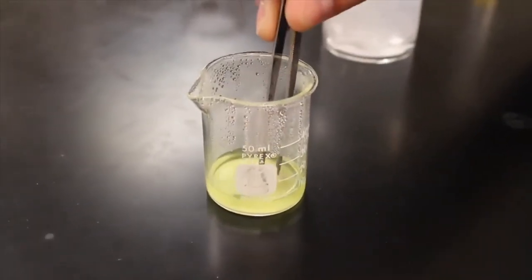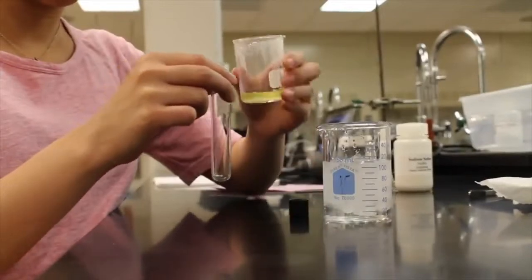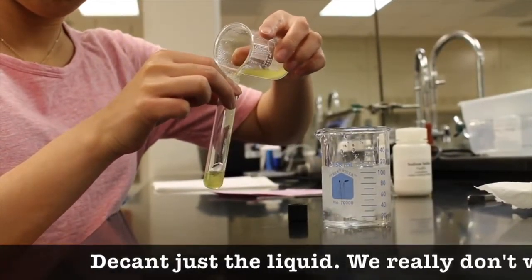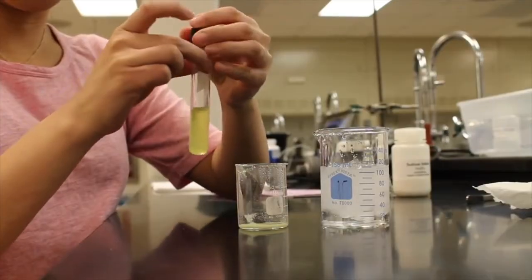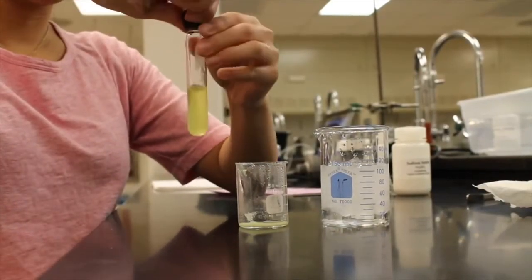Remove the spin bar from the 50 milliliter beaker. Once you have allowed the solution to cool and the solid has settled to the bottom, decant just the liquid into a centrifuge tube. We really don't want any of the solid to get in. And then put it in an ice bath for 3 minutes.